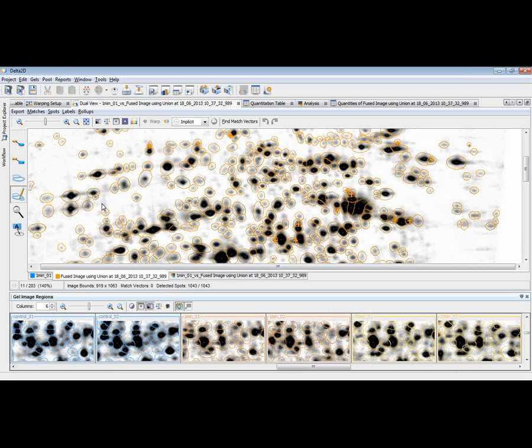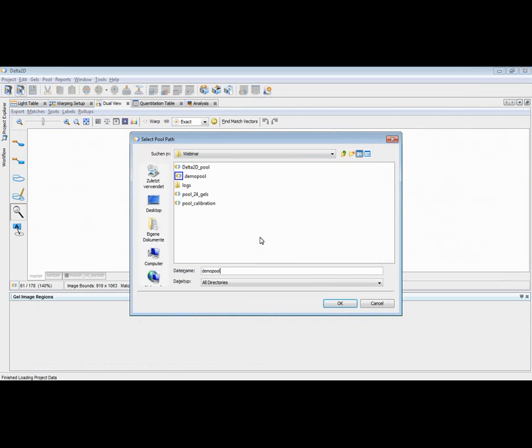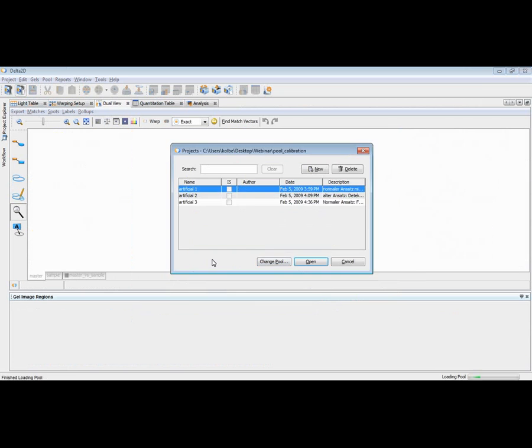Just a second. I would like to open this other project. I have to change the pool. I start these changes here. And I want to open the project which shows this example.